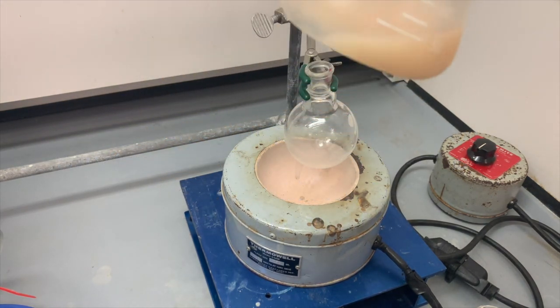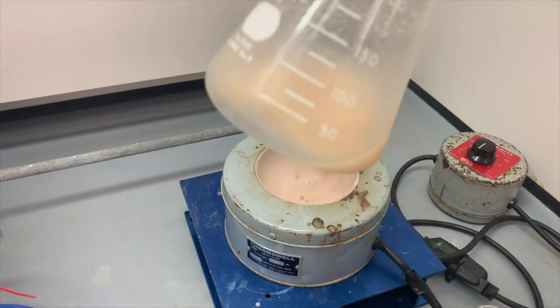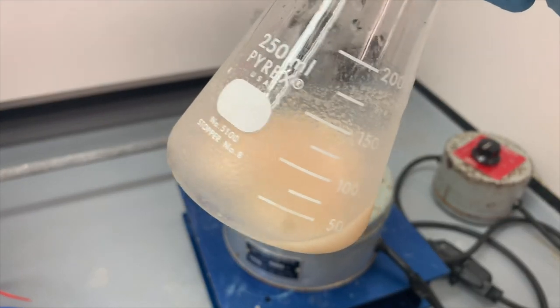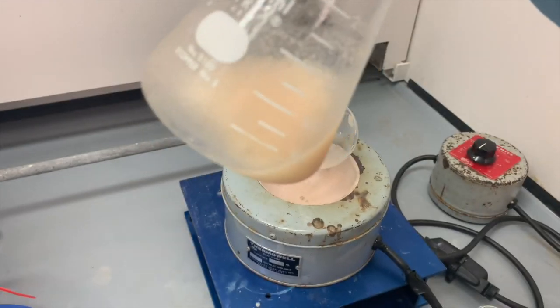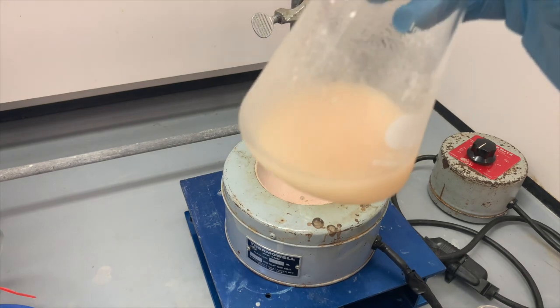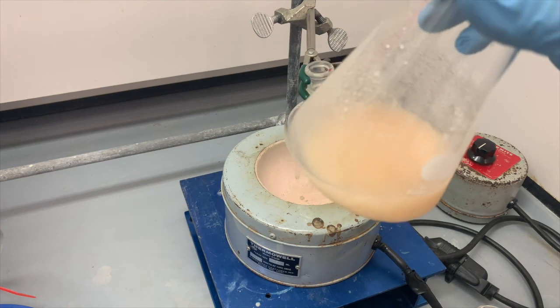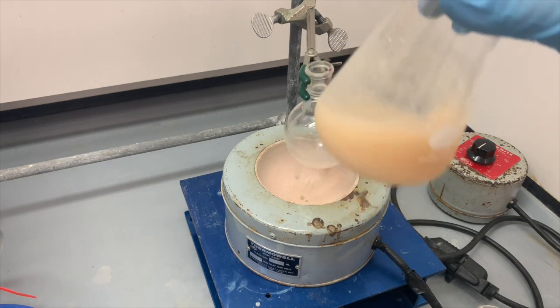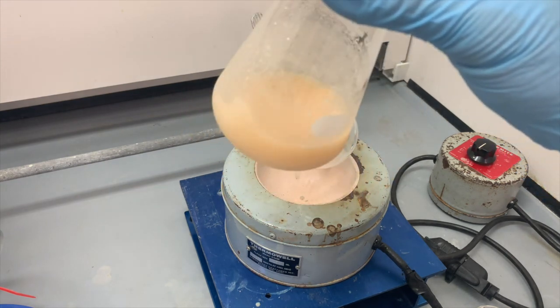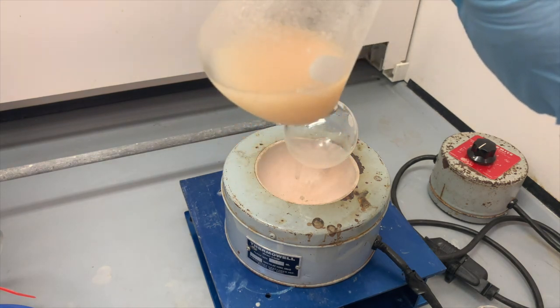Okay, and so this is our mixture. You can see on the side of the flask, some solid formation. There we go, now we're focused. You see the formation of solid. That's not ice. That's not little ice particles. That is going to be the product of this reaction. We are precipitating it out. The product of the reaction is soluble in ethanol, but it's not soluble in water. But it does have a melting point of about 30 degrees. So we have to get it nice and cold in this water mixture in order to form a solid suspension of the product.